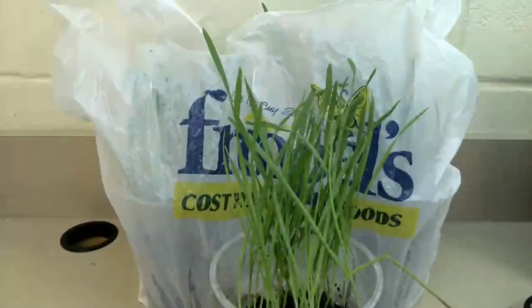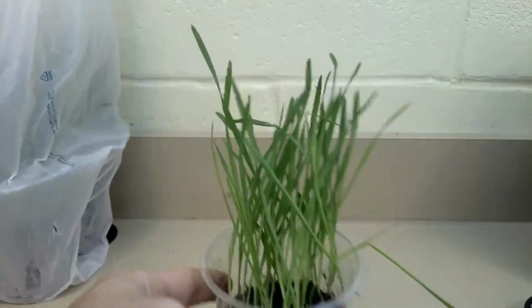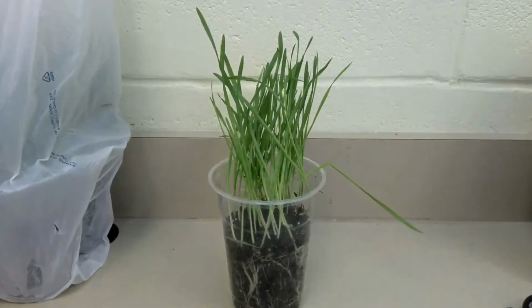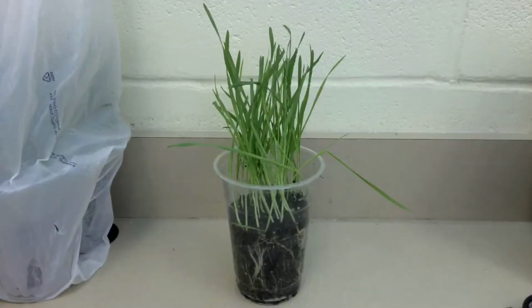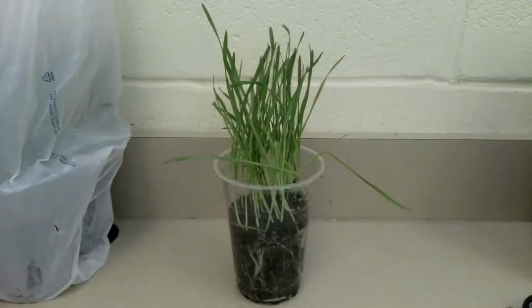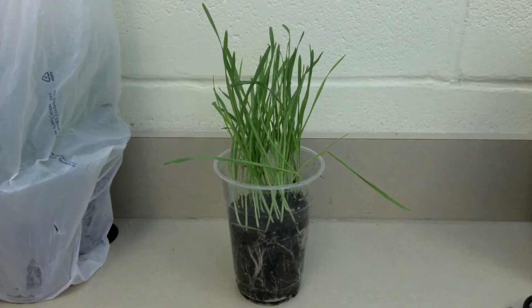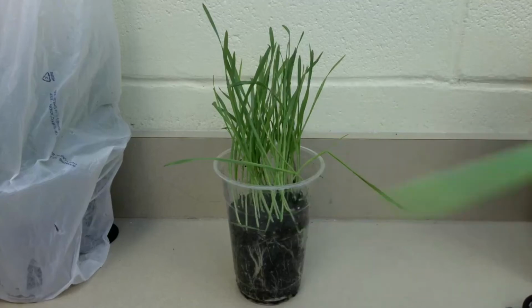This is a specimen from our second group, the white bag group. So, what do we notice here? Well, again, we are now making observations in our box for the white bag group. So once again, we are observing things that we can describe. So describe the color, right? And notice that there is a change in color from bottom to top, so that's important.